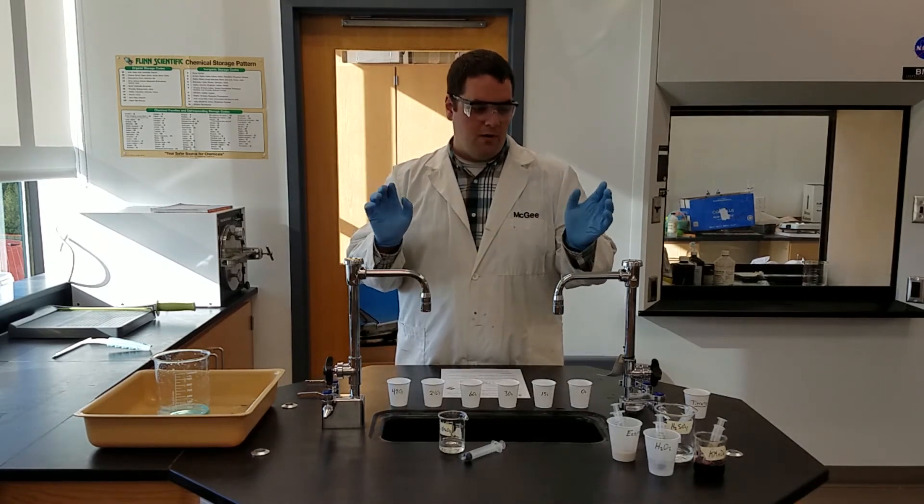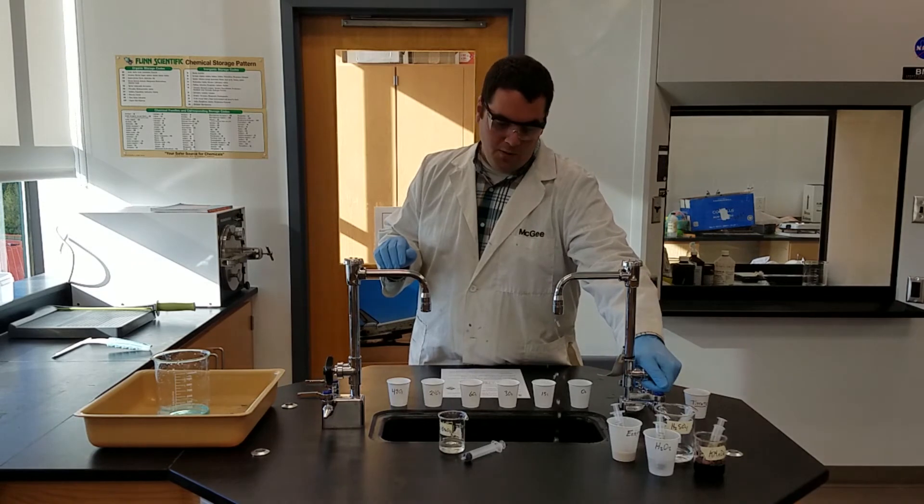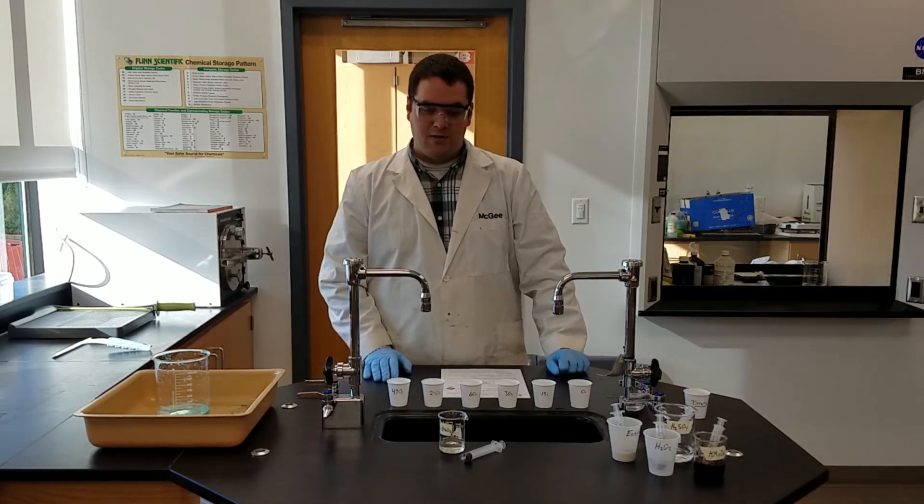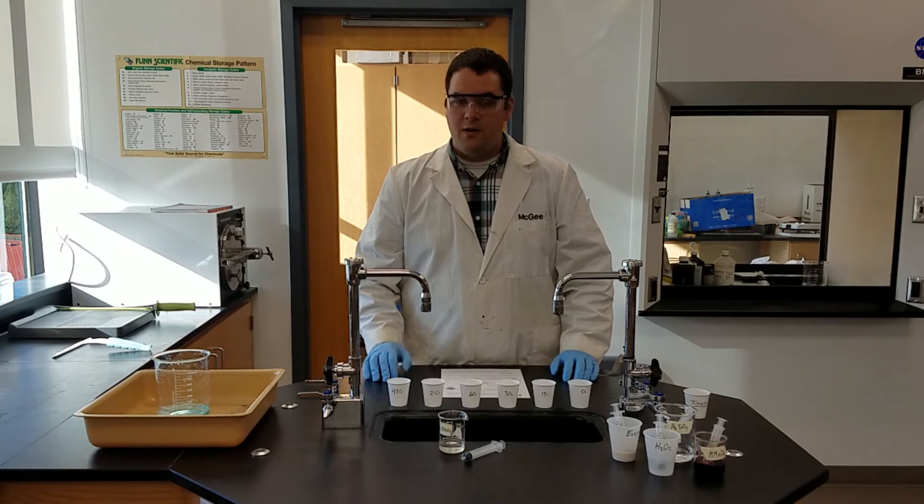If you get a little acid or chemical on your finger, the sinks are always available and you can rinse your fingers off. So with that said, just make sure everything is cleaned up and put away.